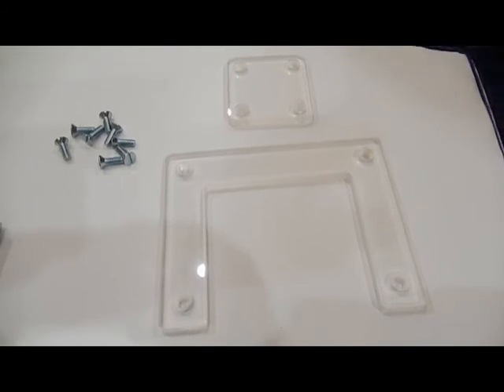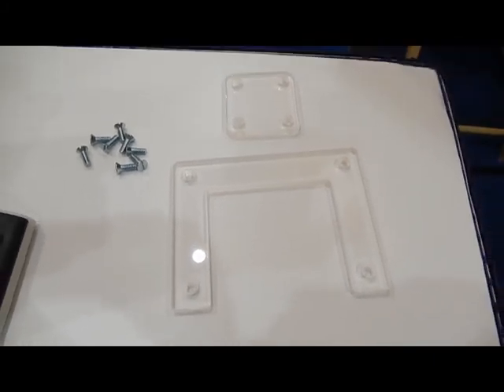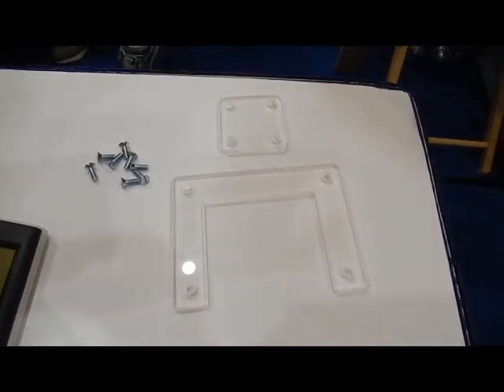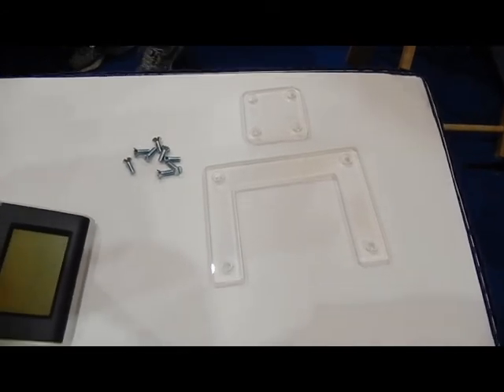The connector screws are countersunk so the beveled edge of the connector plates should face the outside when the unit is assembled.